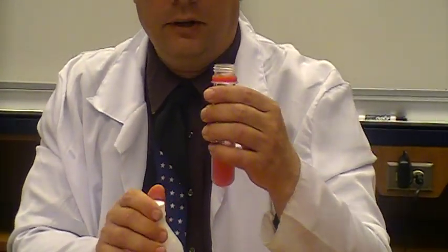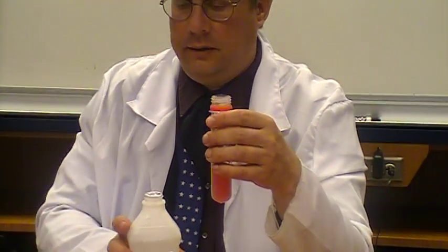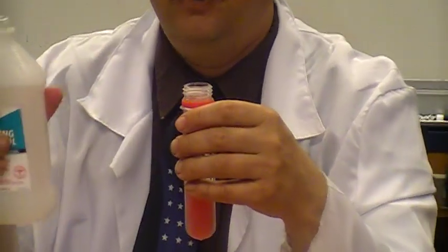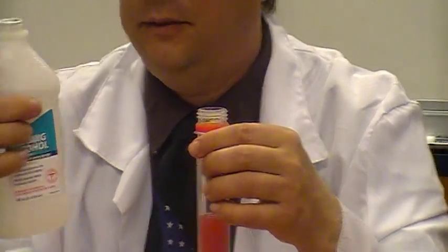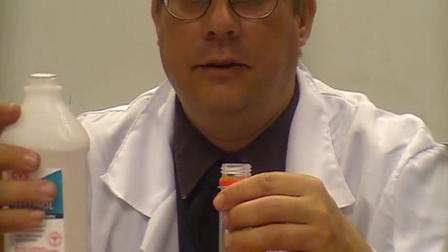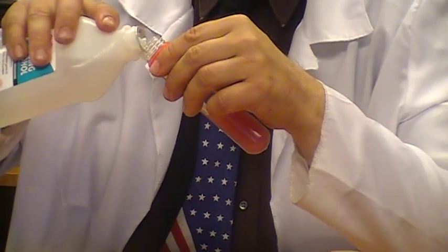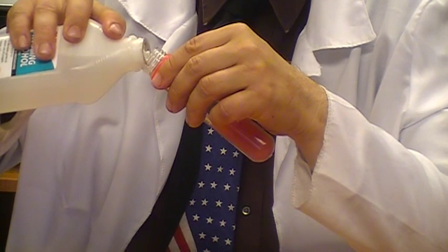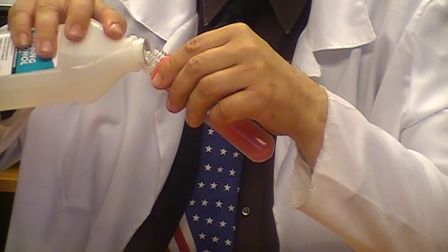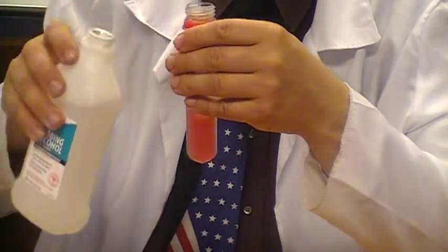And that's because DNA does not like alcohol and it's all going to clump together. So, you want to be very careful. You want to make sure this alcohol is very cold. We just took it out of the freezer before we started this experiment. And you want to carefully, without mixing it, pour an equal amount of alcohol into here.